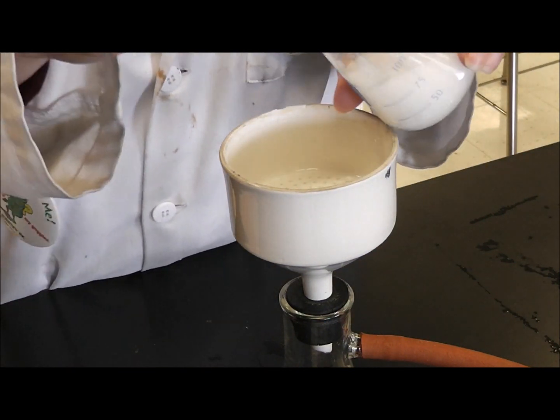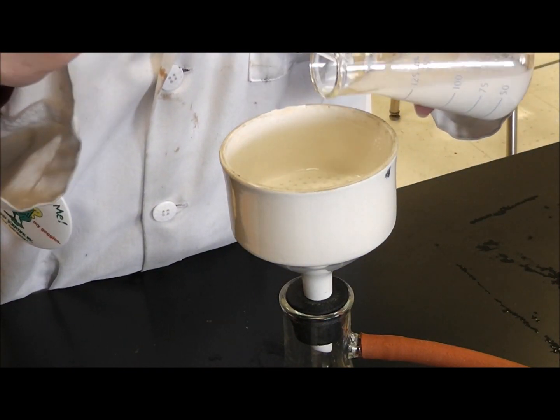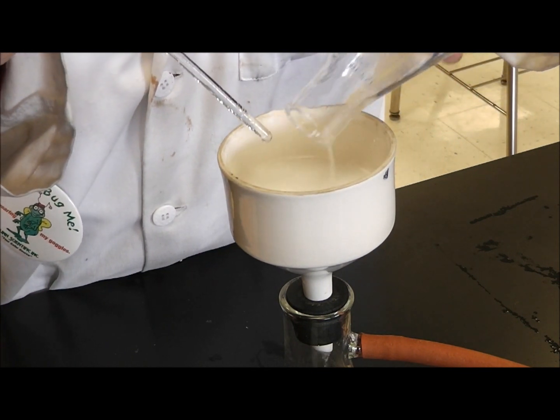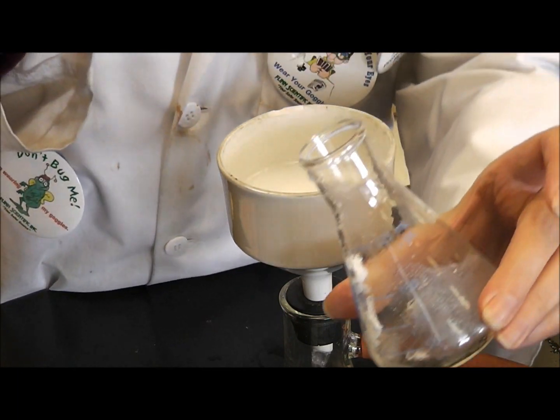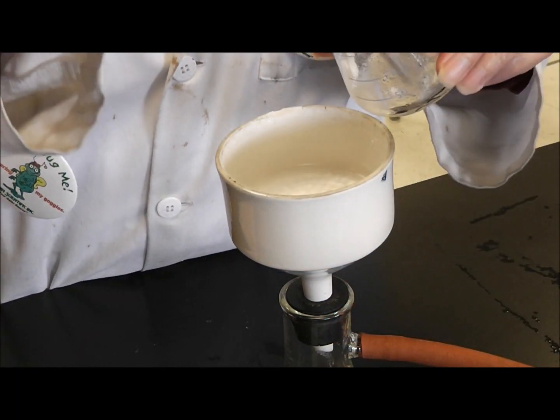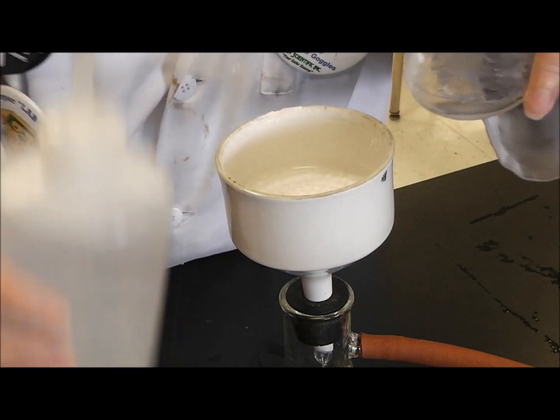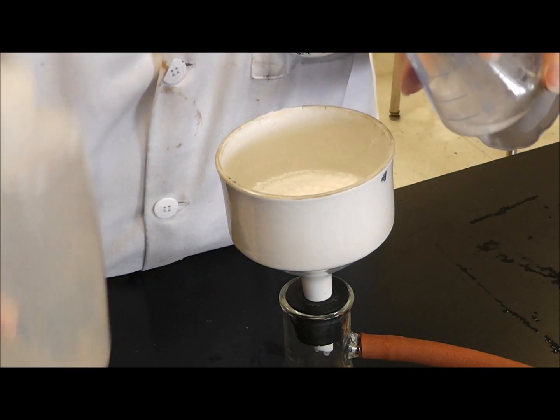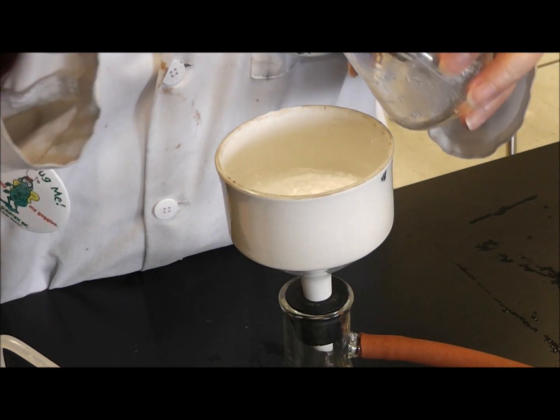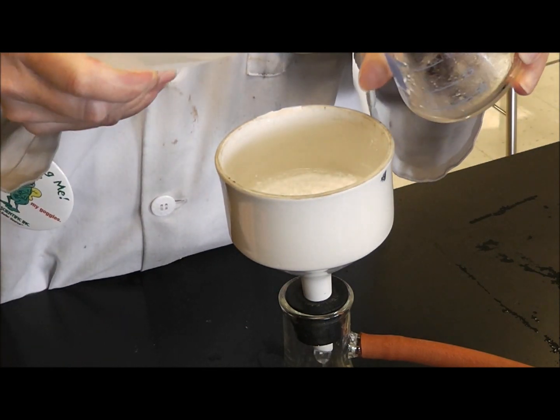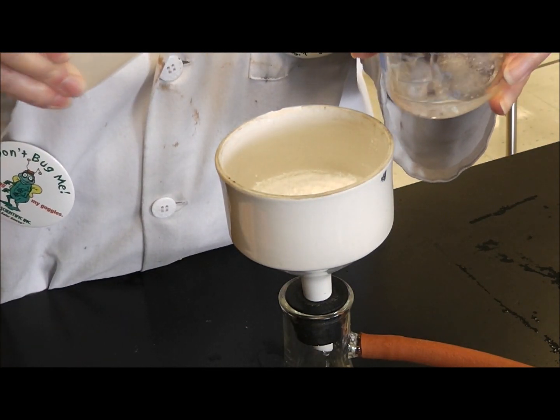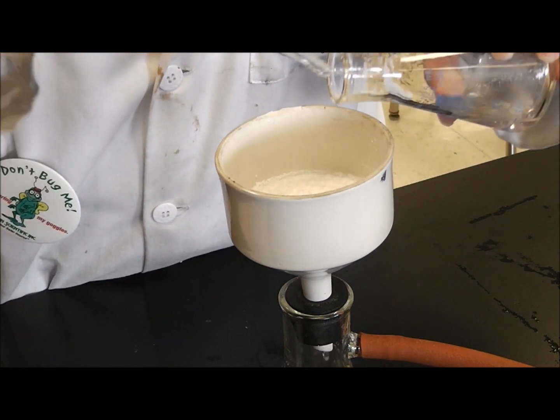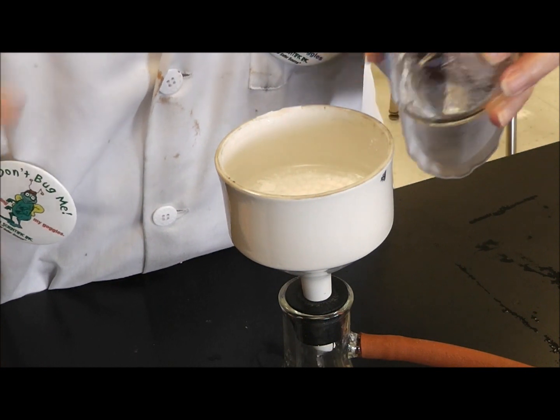I am going to take my aspirin, and I am going to filter it. I am going to clean off my rubber policeman. You will notice a lot still gets left in the Erlenmeyer. So what I am going to do is, wash it, wash it, scrape it, wash it, scrape it. So I am going to wash it out. Wash it again. I want every little piece of aspirin to wash it again.